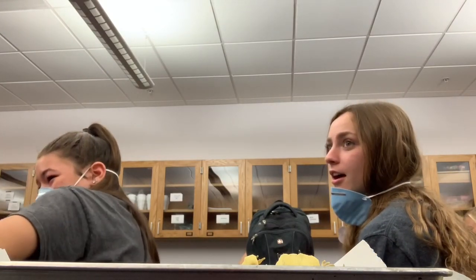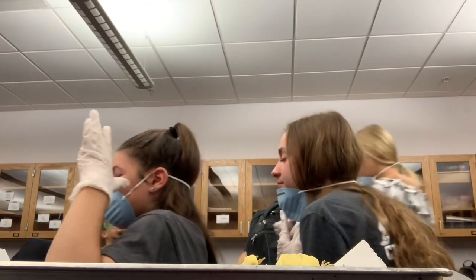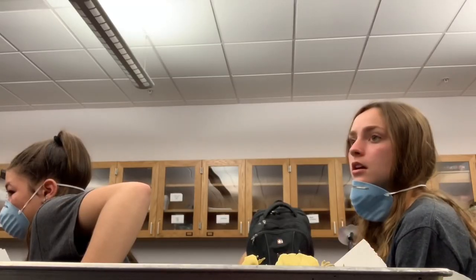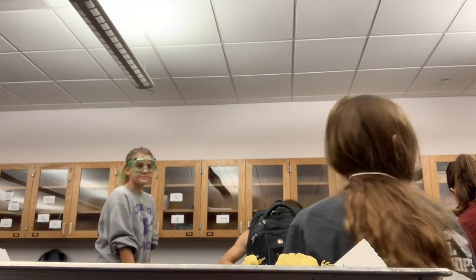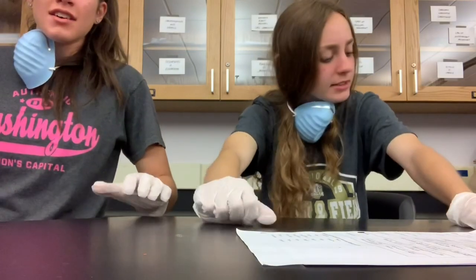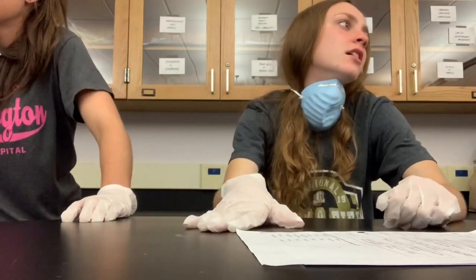I'm good — you're not even doing it. I'm good, I'm good. Oh my god, I need to go take a walk. All the juices are actually — I can't hear anymore. What? Do I look like I'm going to pass out? I feel a little weird. Sit down. We have eggs! Is ours pregnant? Ours was pregnant. Is this a sign of passing out or dying? Stop — Hannah, sit down. Oh my god.